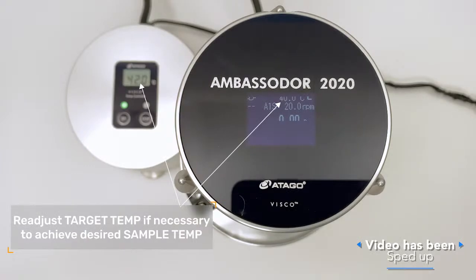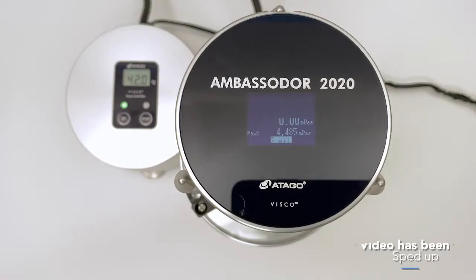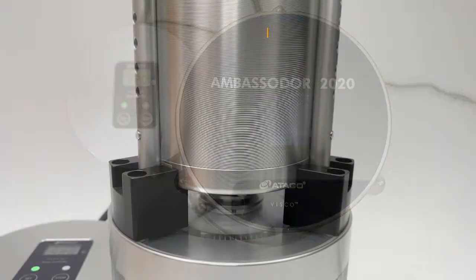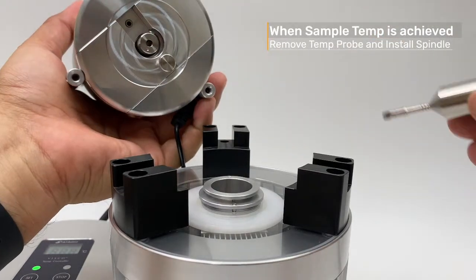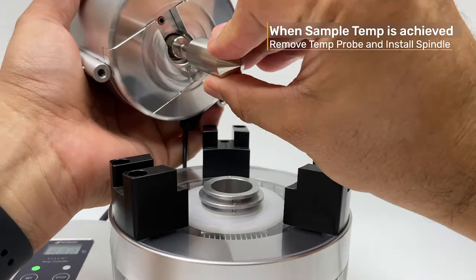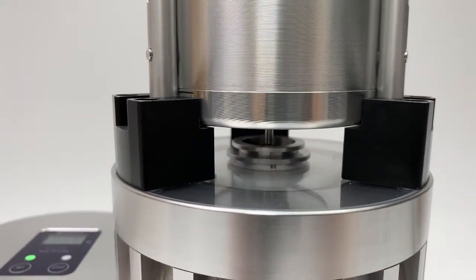Hopefully that's not too confusing — what's important is the temperature of the product, not the numeric value displayed by the controller. You adjust the controller to achieve your sample's target temperature. Once the sample is at the correct temperature, remove the temperature probe, put in the A1 spindle, and start testing.